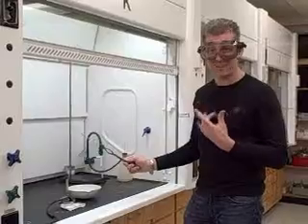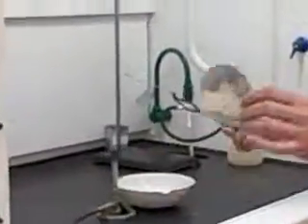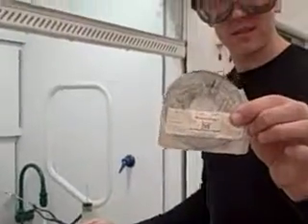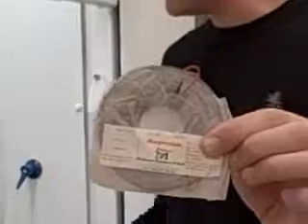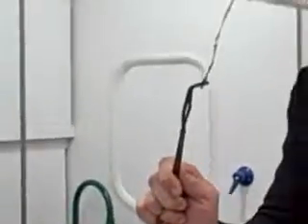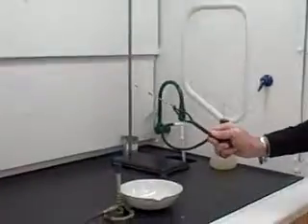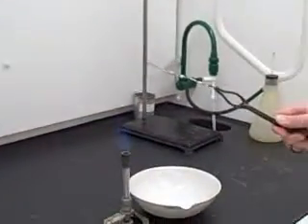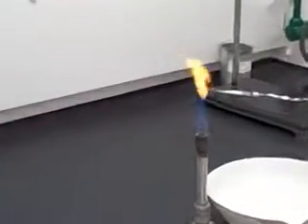I'm wearing goggles because this is a chemical reaction. We are going to react magnesium. You can see that this is magnesium. Its particular form is magnesium ribbon. I've shined up a piece of it here, and I'm going to ignite this magnesium ribbon, basically increase its temperature so that it will actually react with the atmosphere.